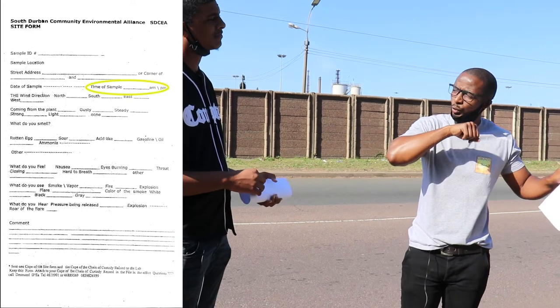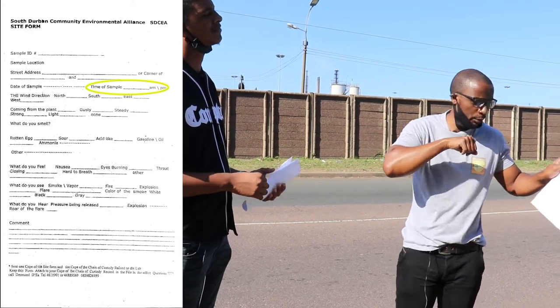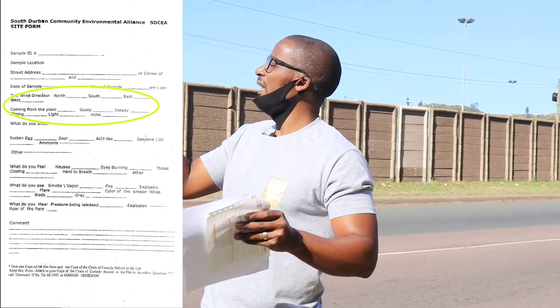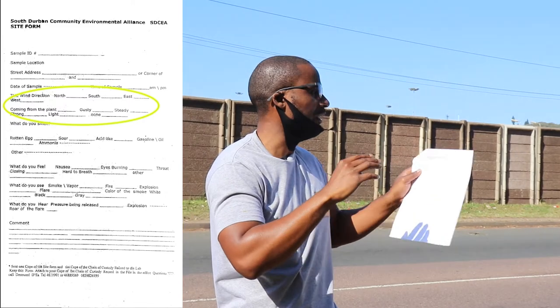The time is also crucial, it's very important. And then the wind direction — it's easy, it's a matter of just looking at the trees and seeing, okay, the wind direction was southeasterly and so forth. But sometimes the wind is very tricky, the wind is steady, you look at the trees, you look at the leaves and you literally cannot see or differentiate where the wind is blowing. It's fine, you can leave that out.